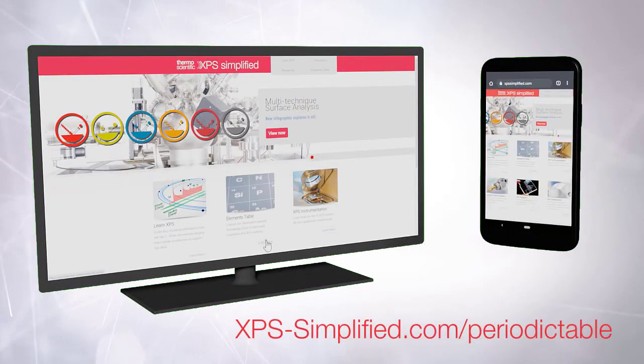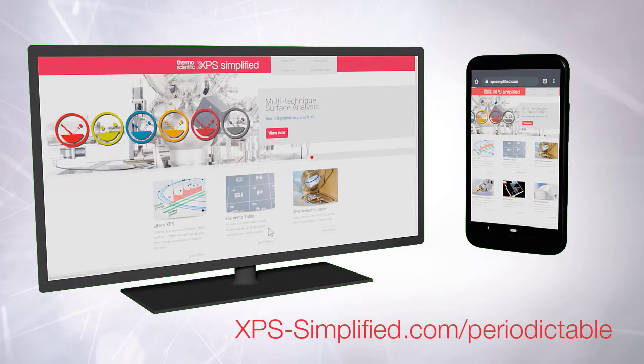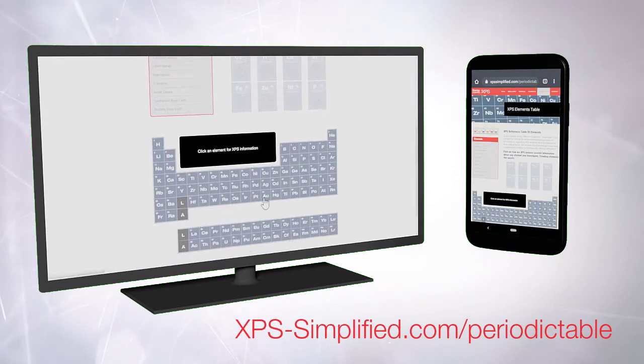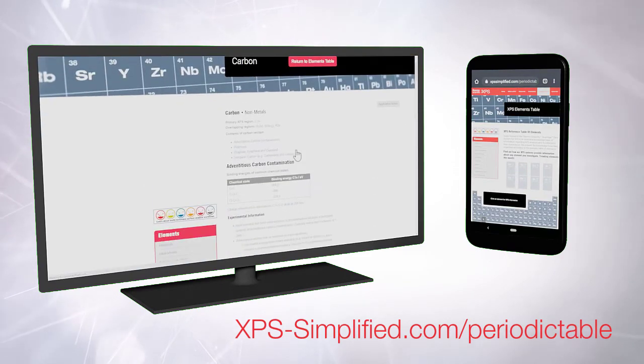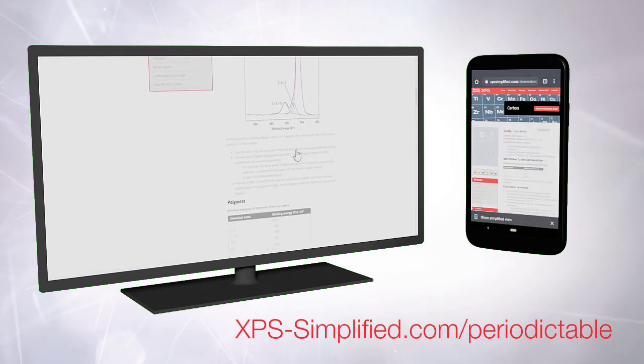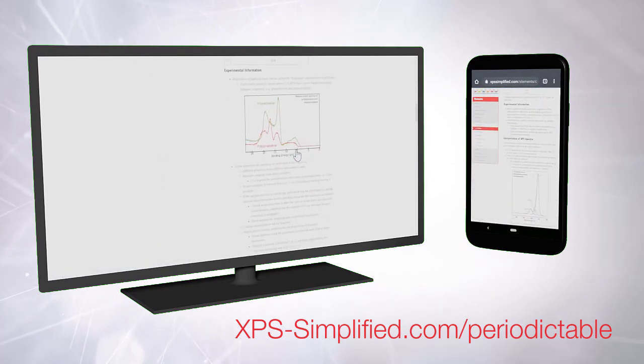As well as being integrated into every copy of Avantage, the information contained within the Knowledge Viewer can be accessed online at xpssimplified.com. So you can find information about XPS analysis wherever you are via a web browser or even on a mobile device.